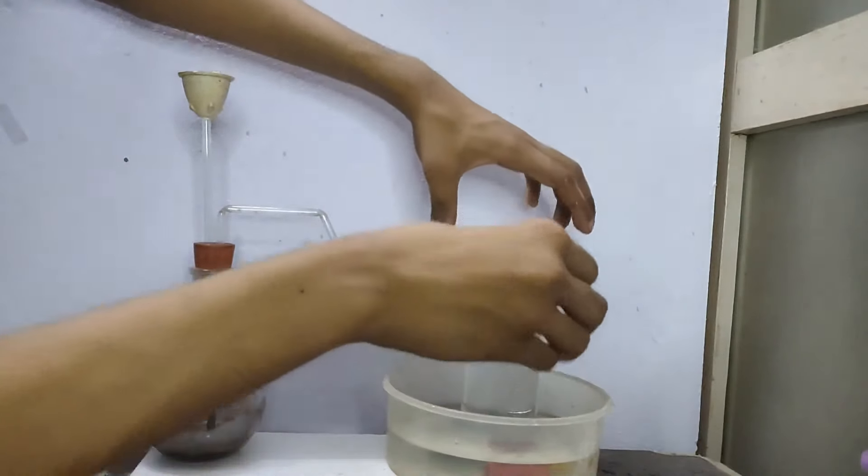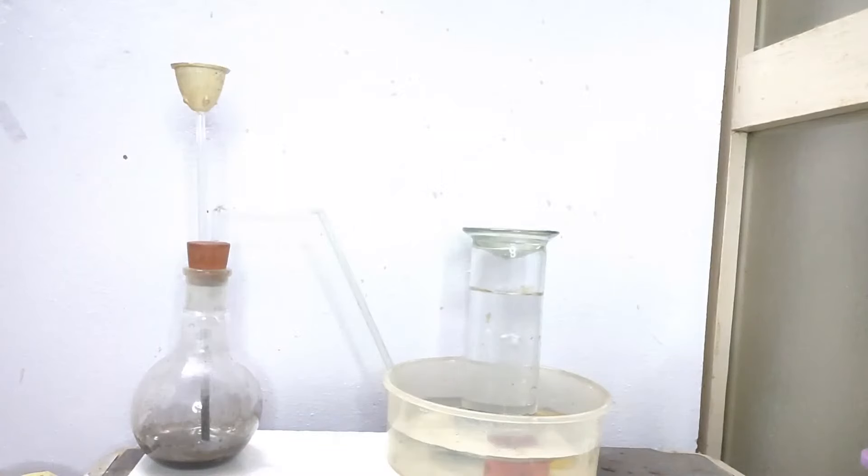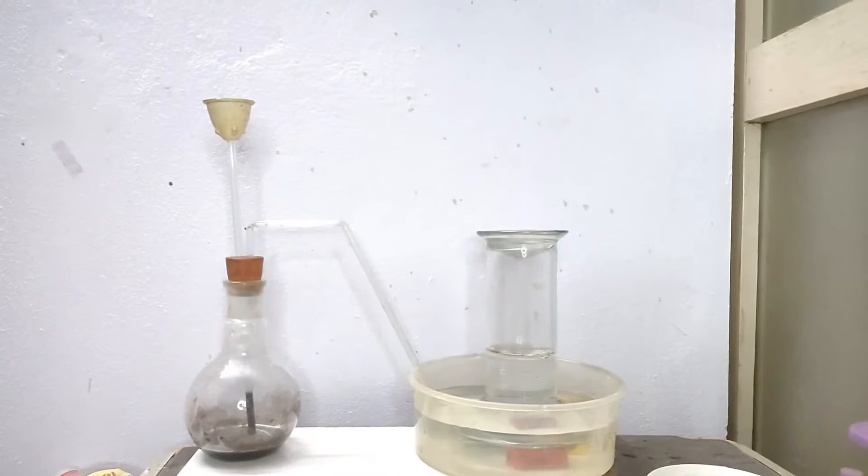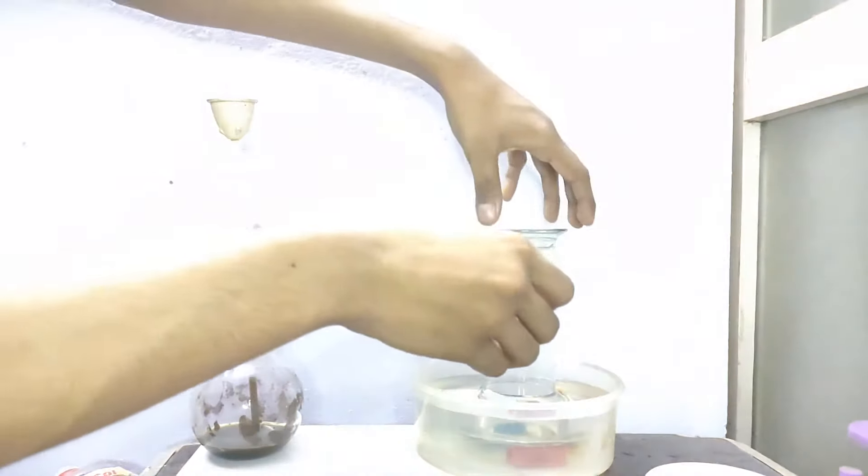Now this will take some time to fill the gas jar. I just touched the flask and it appeared warmer. Because this reaction is exothermic reaction, which means that heat is generated in this reaction. Therefore the flask gets hot.